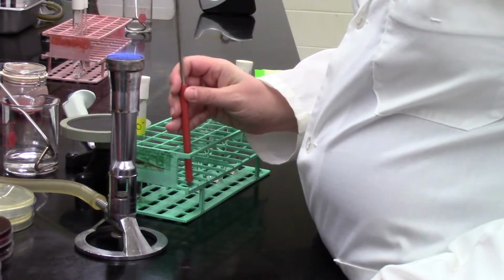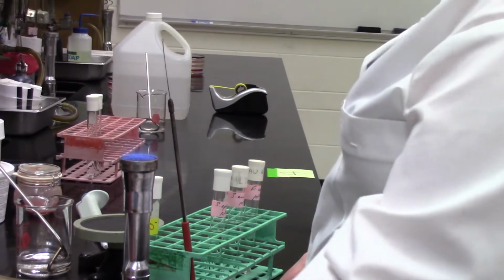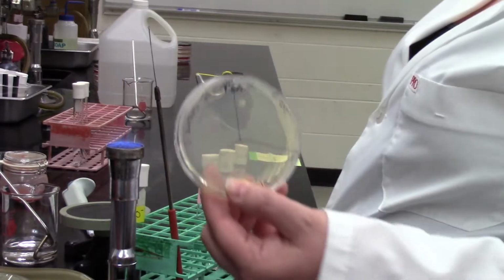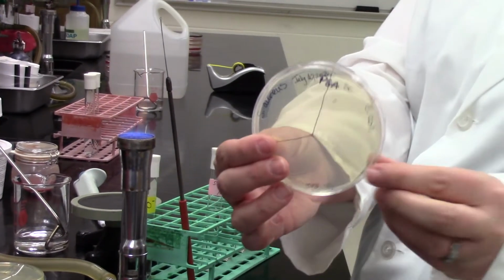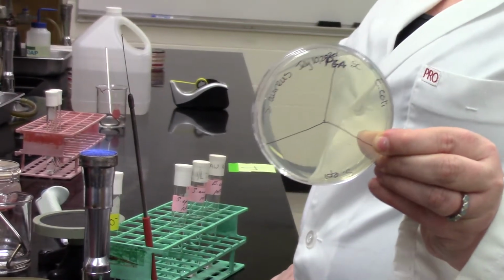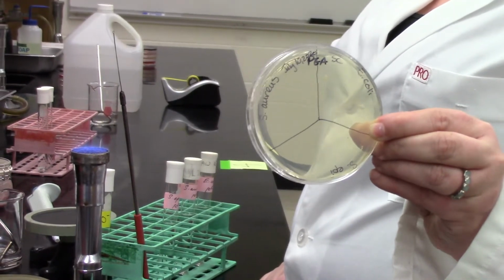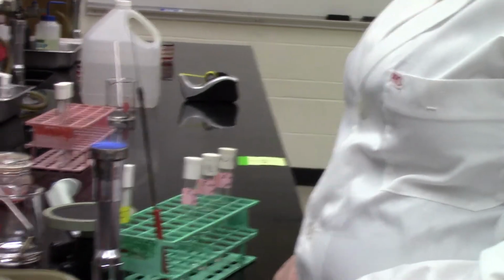So you can see that Sabrina's just getting her loop there. She's flamed it, got it nice and red hot. She's letting it cool right in the sterile zone. And she's going to grab out a plate, and you can see that really clearly. So in this case, we're not doing a full streak plate. We want to see growth of these bacteria, but we're not so interested in getting isolated colonies. We know we have a pure culture here. Isolated colonies are great, but we're not trying to get a whole streak plate of them.